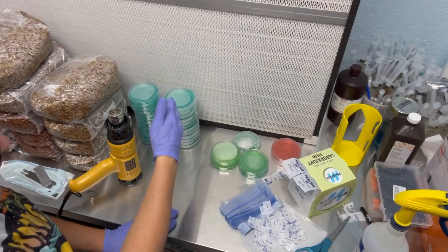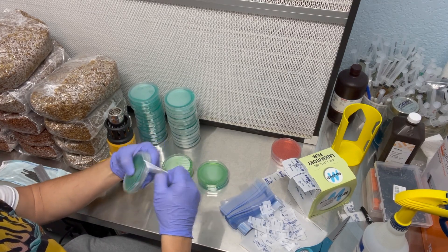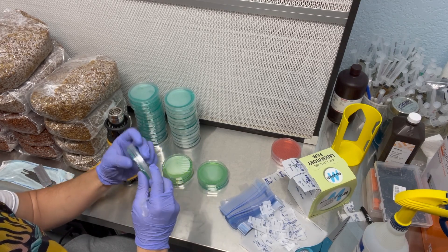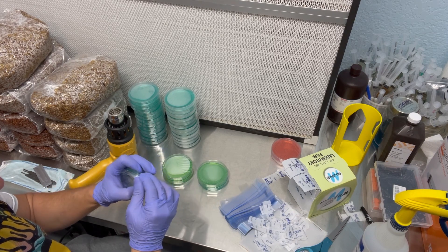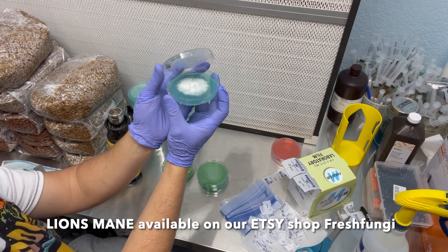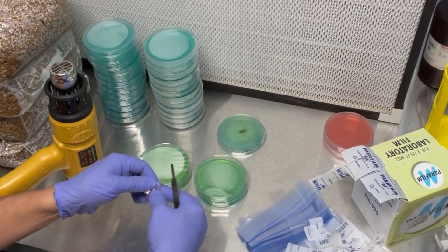So there is the parafilm and the shrink wrap. Now I am going to do my inoculations. This plate has been parafilmed, which is not that difficult to remove — you just got to get an edge going. This is our lion's mane culture, and I am going to transfer that onto these four petri dishes. I'll do two parafilm and two shrink wrap.